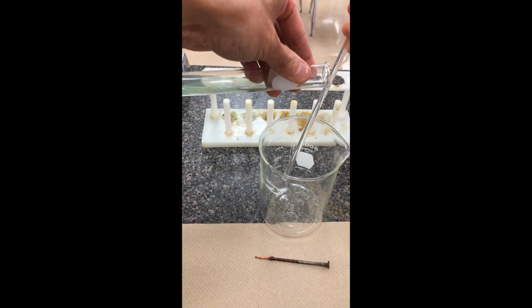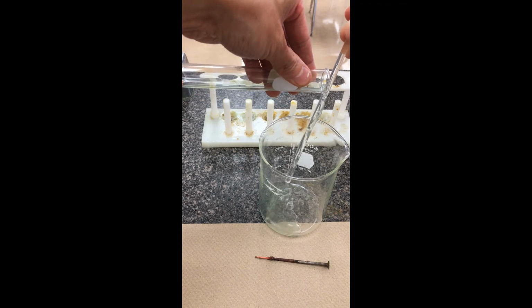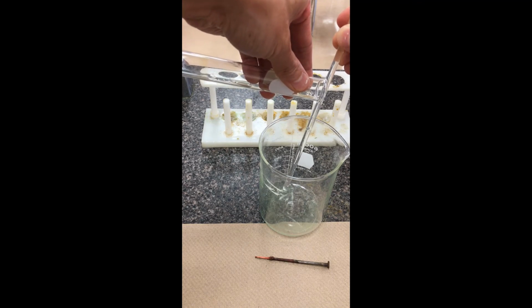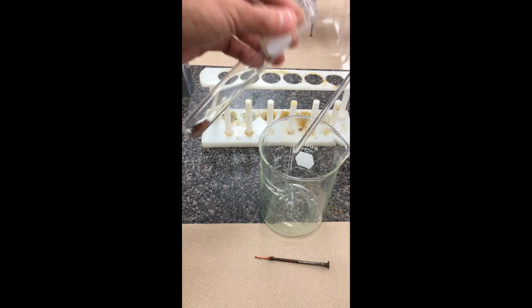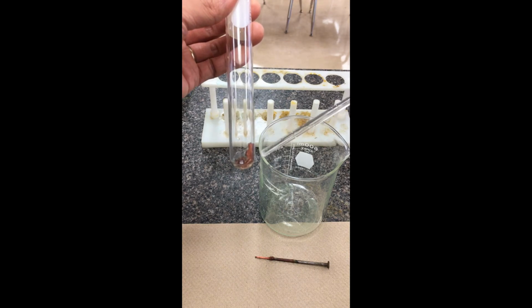So again, this process is known as decanting, especially if the solid is very fine, which in this case it is. Sure, there's still a few grains that might end up inside the beaker, but hopefully the stir stick will try to keep that minimal, and then we would have the solid material at the bottom here.